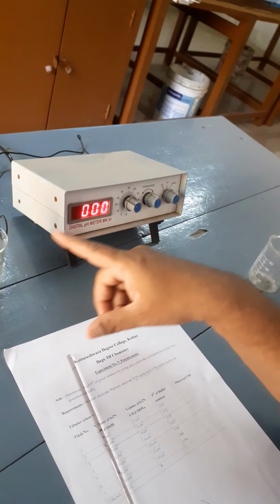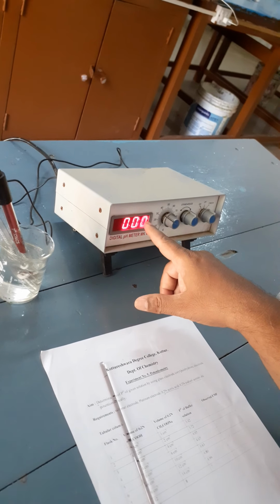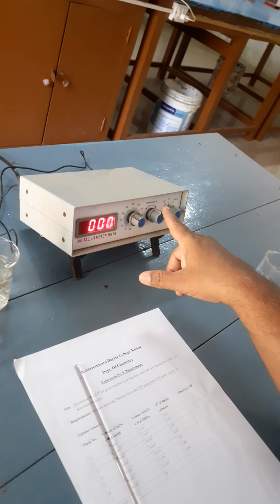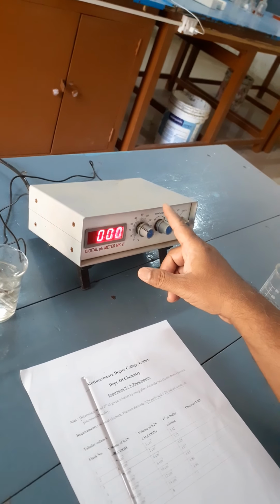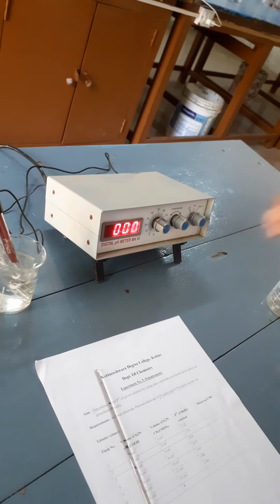Once it is adjusted to 0, it is not necessary to move the standardize knob now. Firstly, we adjust the temperature, and we check whether the instrument is working properly by adjusting the knob to check position and standardize the instrument until we get 0 on the screen.